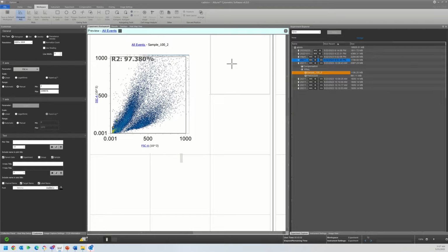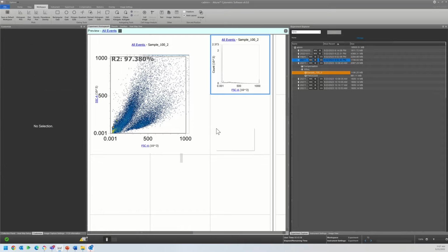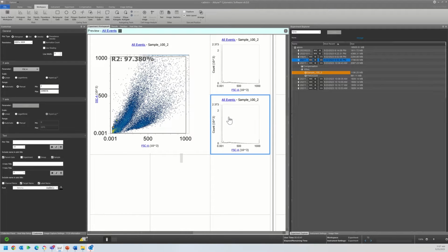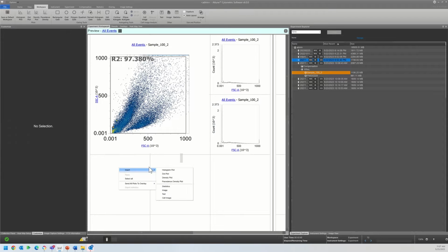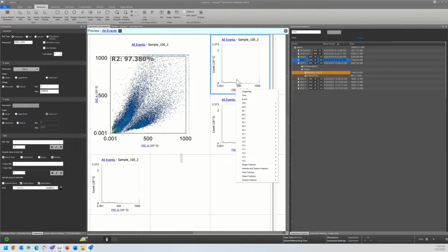The very first steps that we have to do are our quality control steps. And so I'm just going to show this with 3 histograms. You can definitely speed this up with combining some of these into a dot plot. But just for clarity, I'm going to demonstrate each parameter.